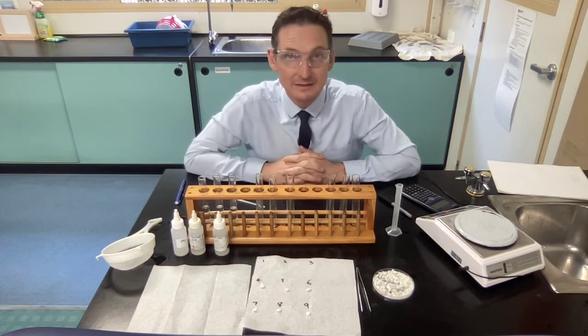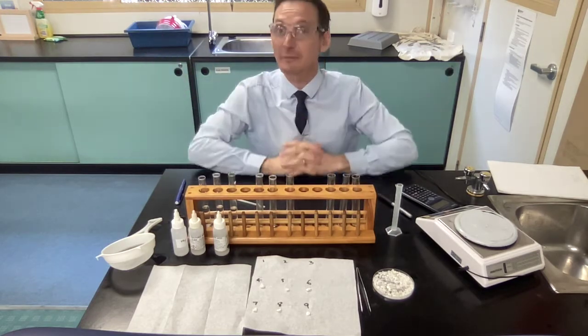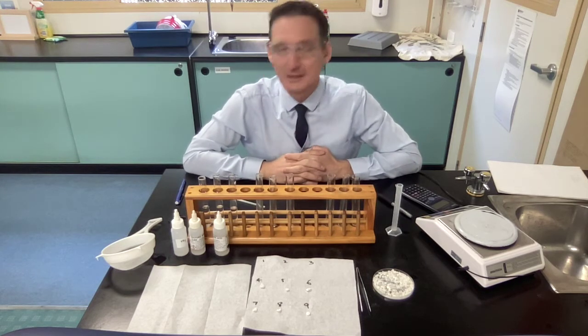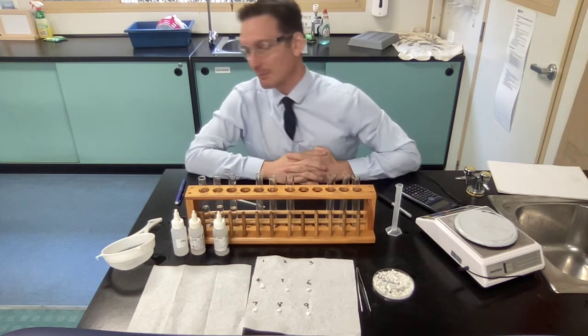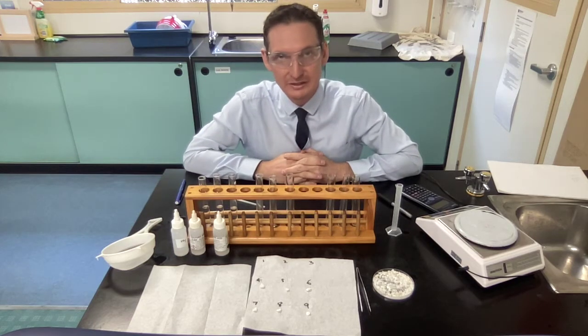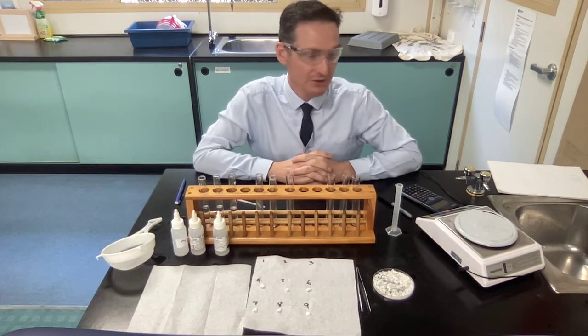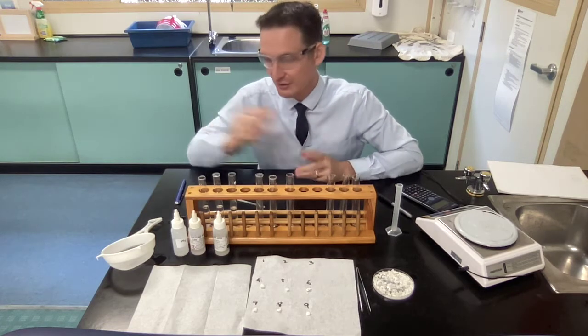Wait 5 minutes. Tick tock. Bing, bing, 5 minutes is now up. How time flies. Now we're going to take these rocks out of that solution and do a post measurement. Measure it after it has been weathered. How do you do that?